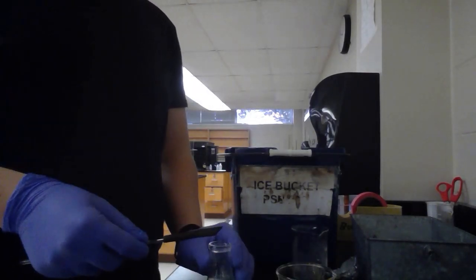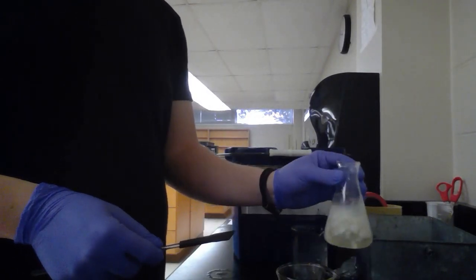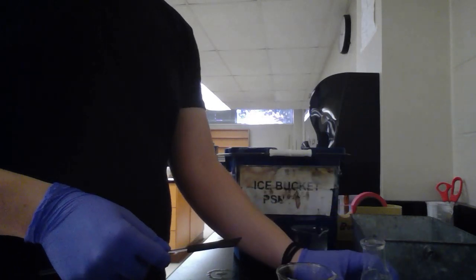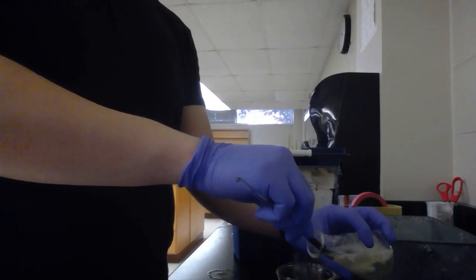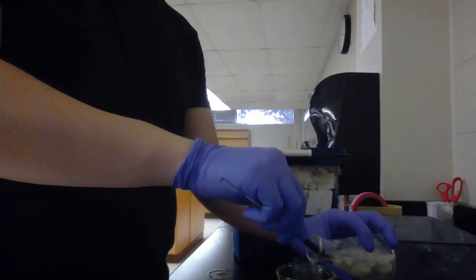Now we're going to decant the sodium chloride solution and leftover water, trying to keep as much solid soap in the flask as possible.